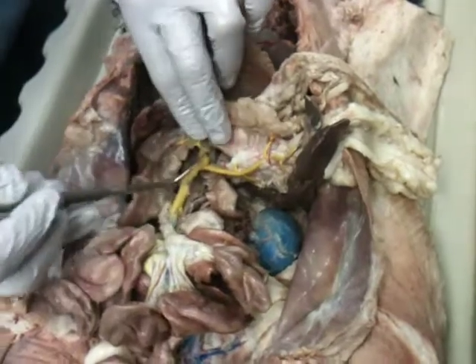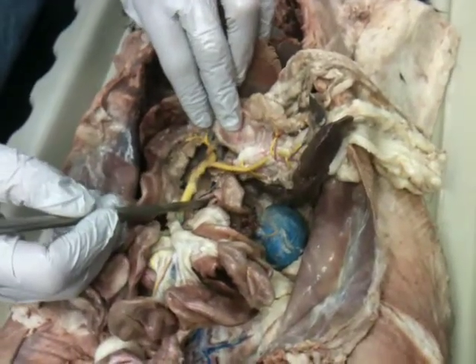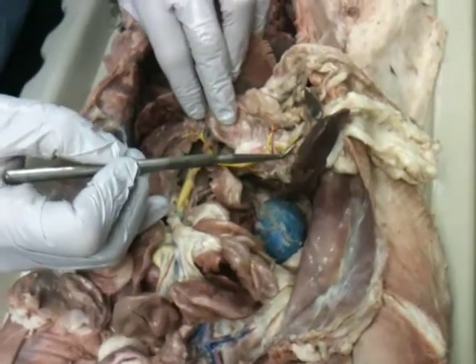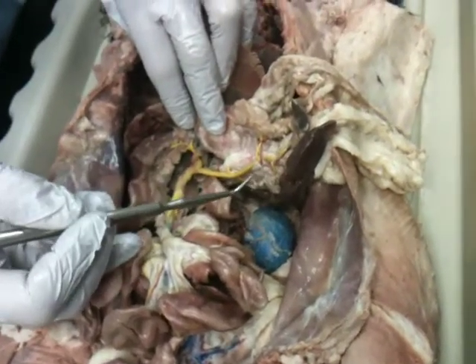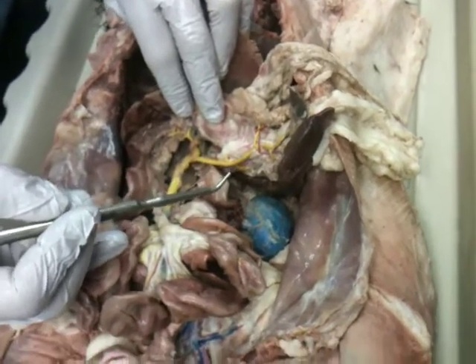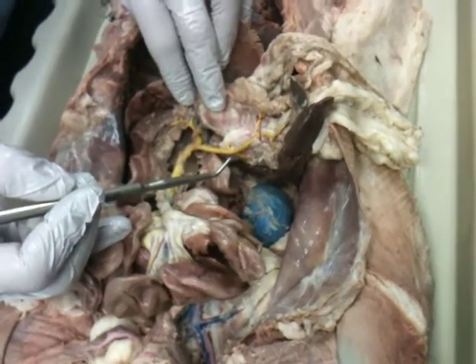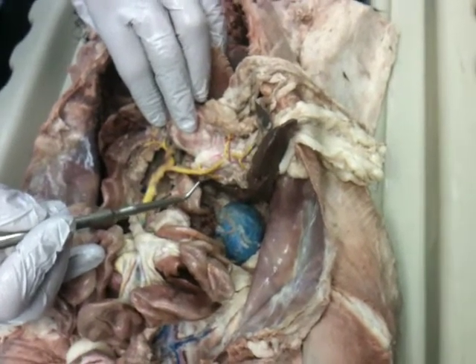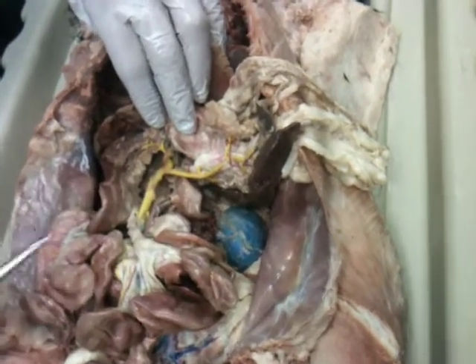Here's our spleen. Can we use left and right like it's in our lab book? Is it left and right for the splenic? Yeah, pretty sure it says left and right. If it says that in the books, then yes. But how would you have a left and a right? I thought it was anterior and posterior. That's what John told us. I know anterior, posterior. Why don't you show me later? Okay.